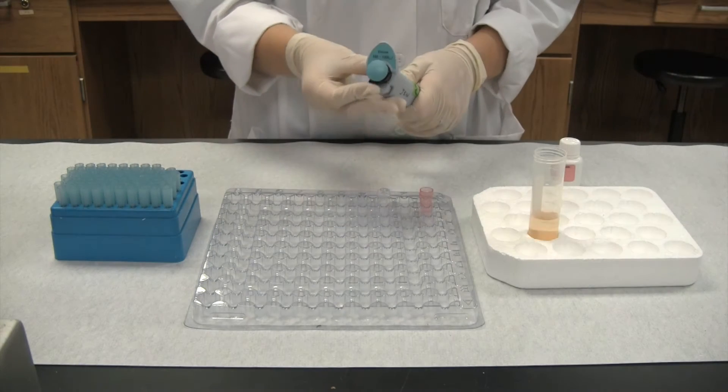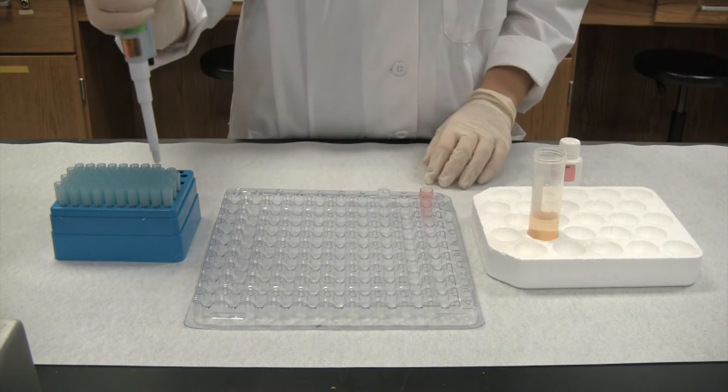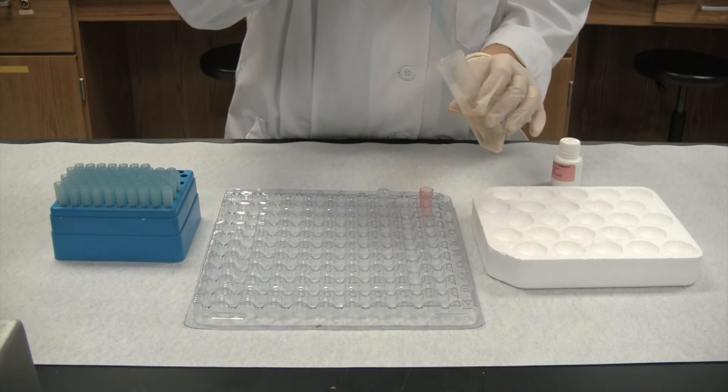Next, using another pipette, add 100 microliters of the filtered sample into the same pink cuvette.